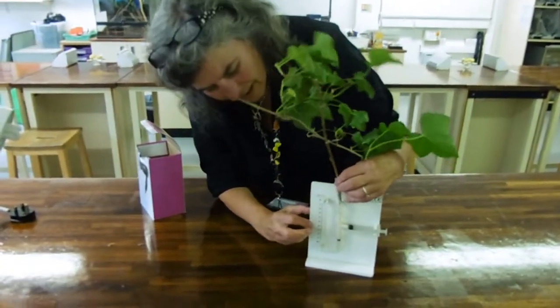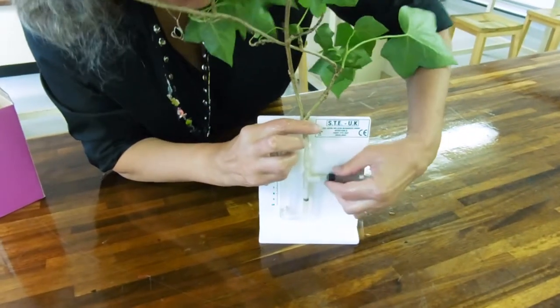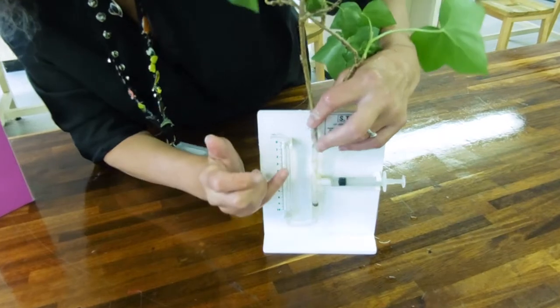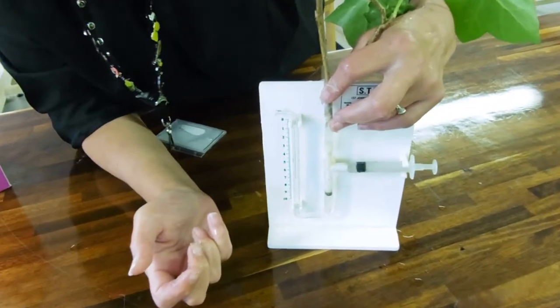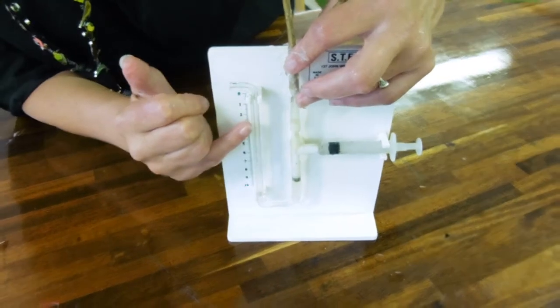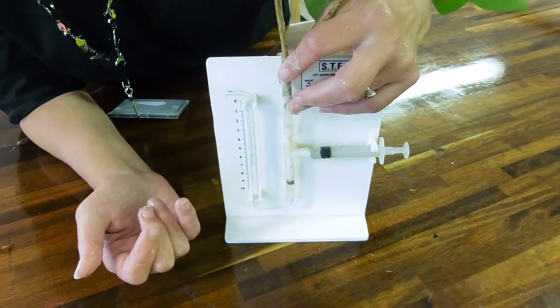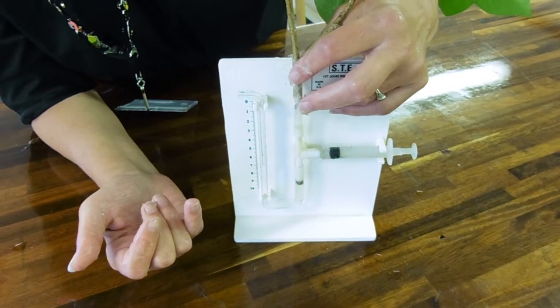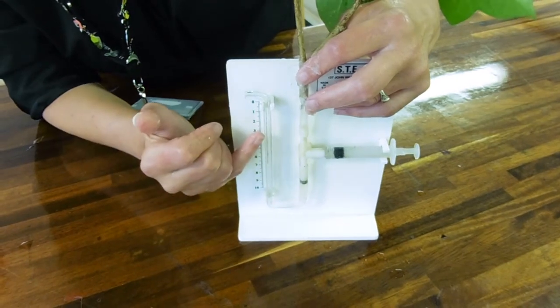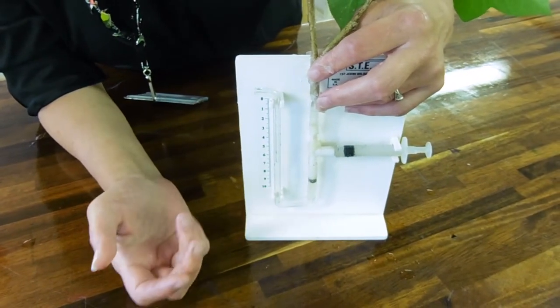To record movement we can use this reservoir to pull an air bubble onto the scale. We can then time how long that air bubble takes to move down the scale, so that we've got a time and a distance and we'll be able to get a rate. That's the minimum data we need. Our dependent variable is the distance that the bubble has moved along the scale in a time interval.